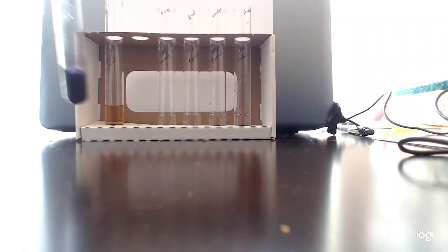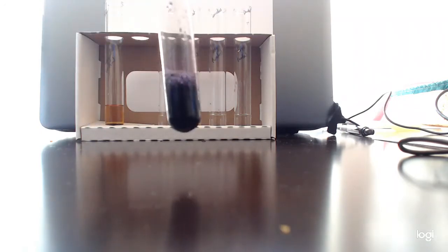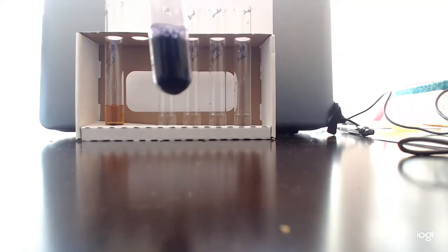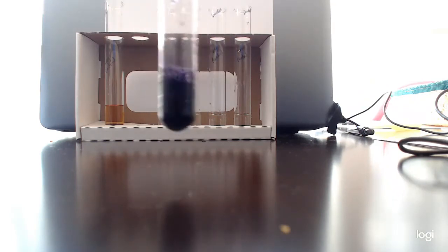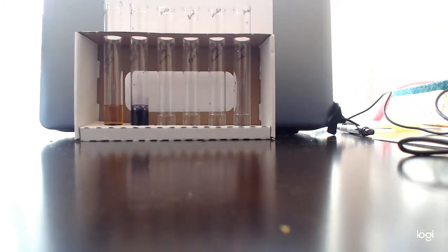Whenever this substance, potassium iodide, is in the presence of anything that contains starch, you can think about it, potatoes, pasta, other grains, anything that has starch in it, this test is going to turn this color, and this color tells me, aha, starch is present. So there you have it. Those are the negative and positive controls for our starch test.